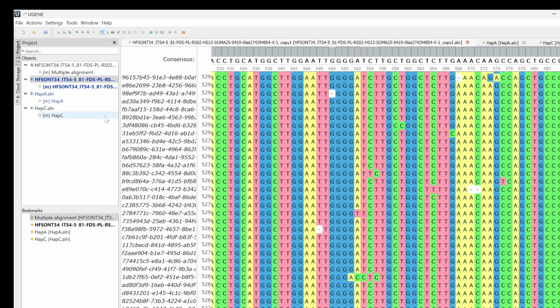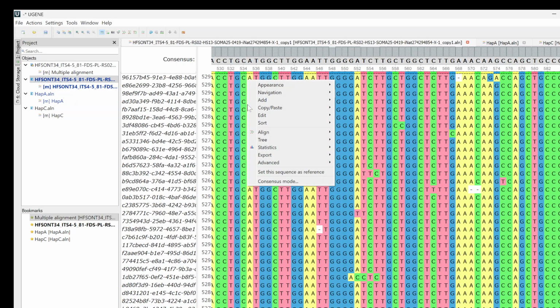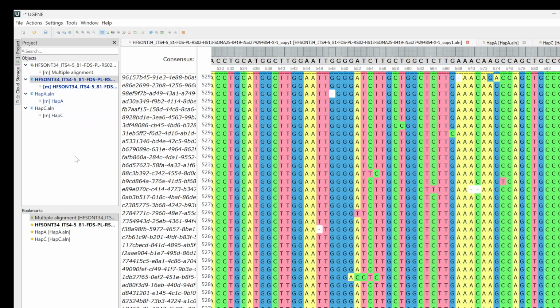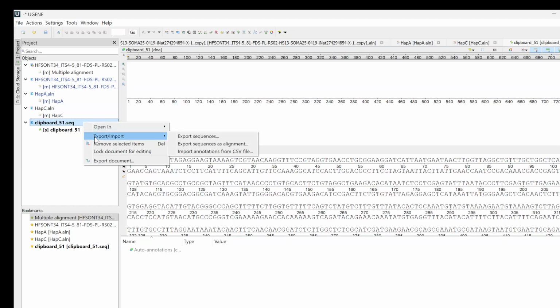Now what you want to do is we'll grab a consensus. So how do I do that again? I right-click anywhere, and I go to copy paste, and I go to copy consensus. And then I'm going to just click anywhere here and paste it. Clipboard 51. Now I'm sure there's a way to rename it, but I haven't figured that out yet. So we're just going to have to remember what the name is. This is 51. We're going to export sequences alignment.